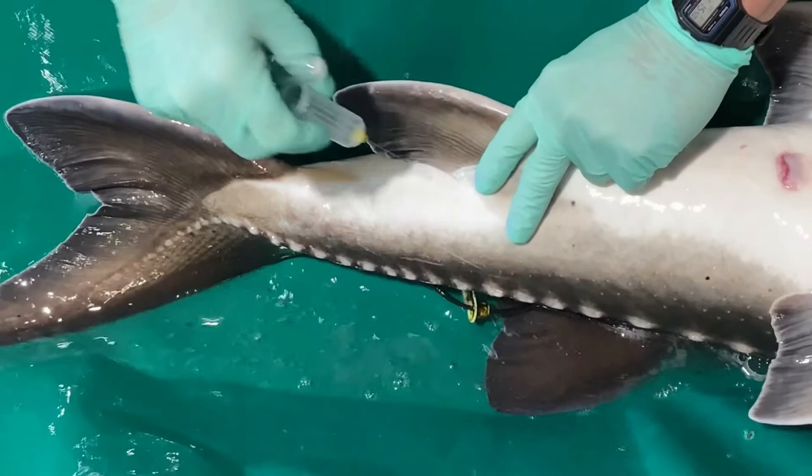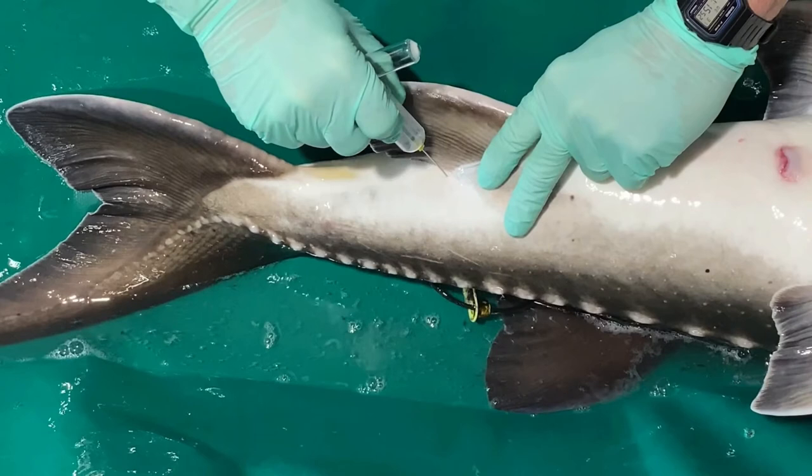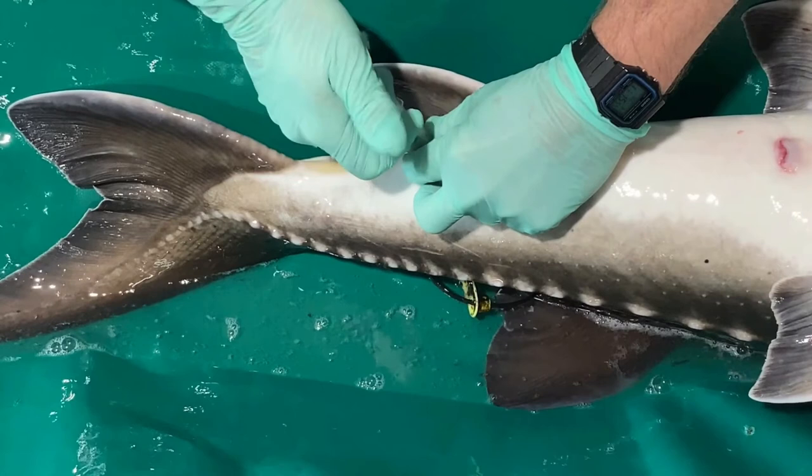The caudal vasculature includes both the caudal vein and artery. The vacutainer is then inserted into the needle holder, and often at this stage of the procedure you will push through the sheath and blood will be seen immediately.